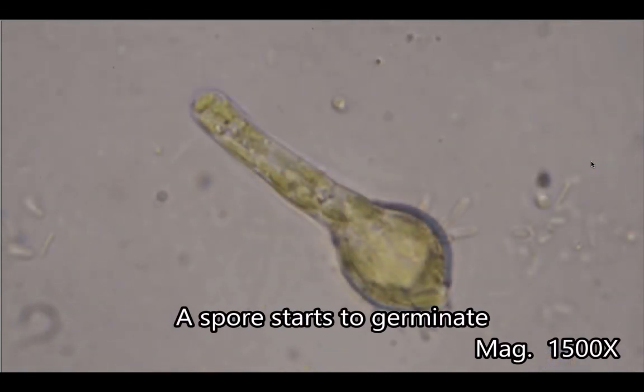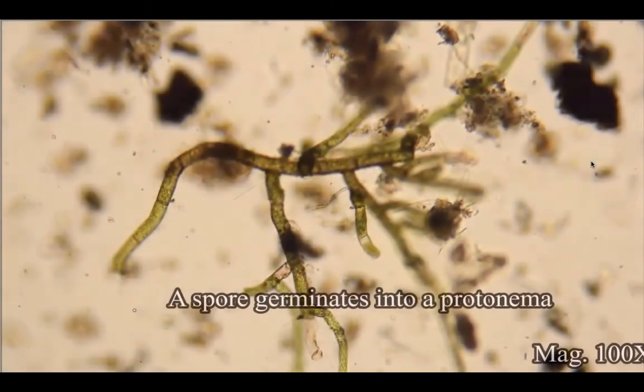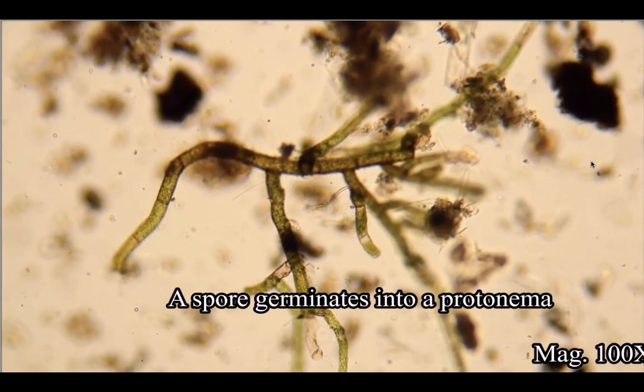So it's starting to grow. And that's the protonema.